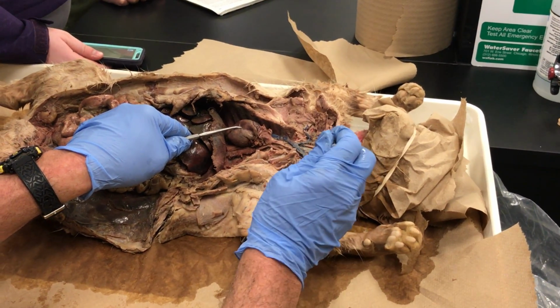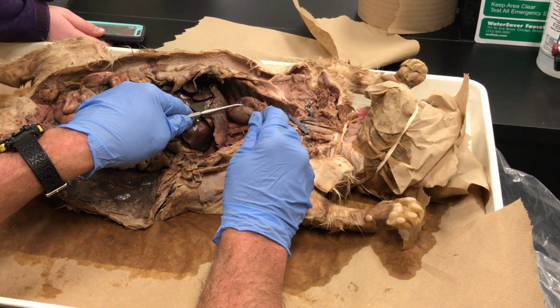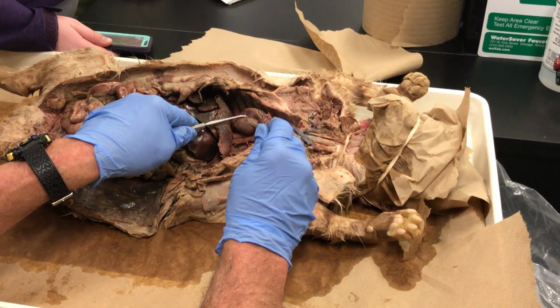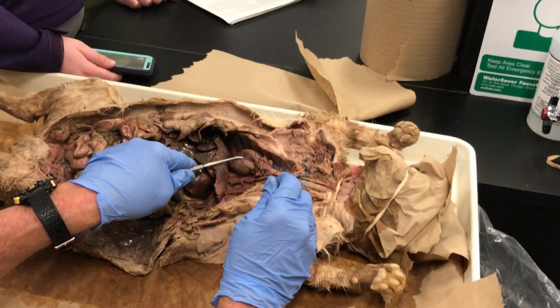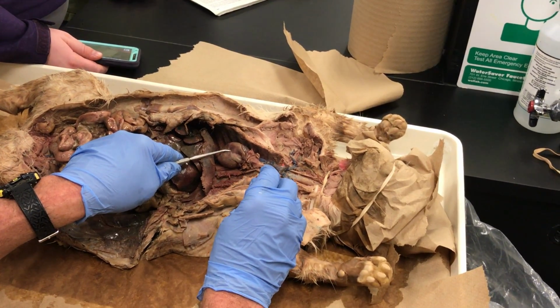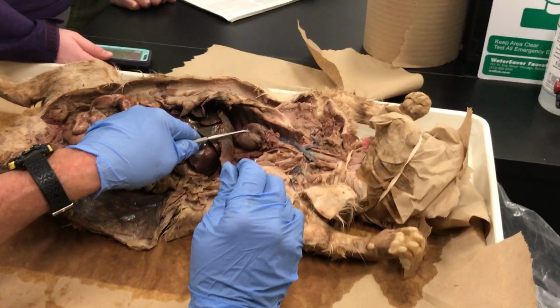And so it's the brachiocephalic on that side. Correct, until it splits into subclavian and common carotid. Correct. So it's brachiocephalic, and then the first branch is the common carotid, and it continues as brachiocephalic until you get your next common carotid. Then what's left is subclavian, axillary, brachial. Okay. All right.